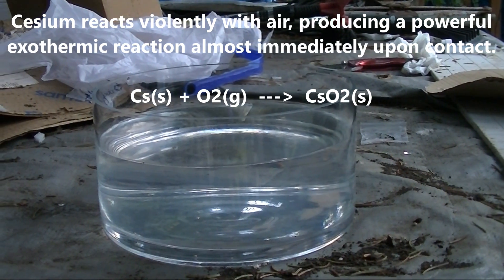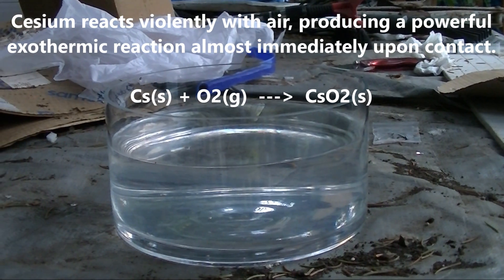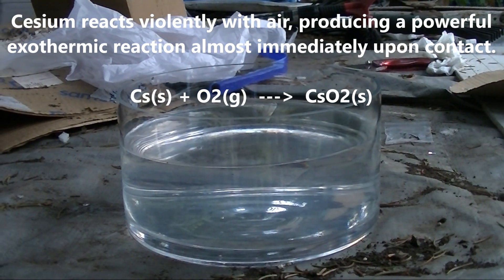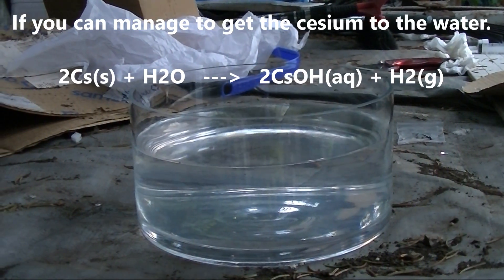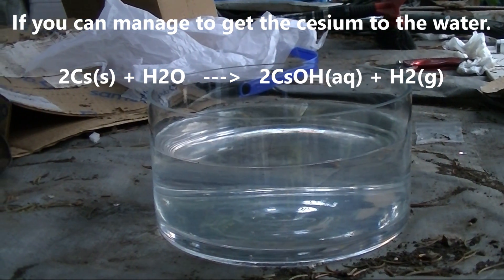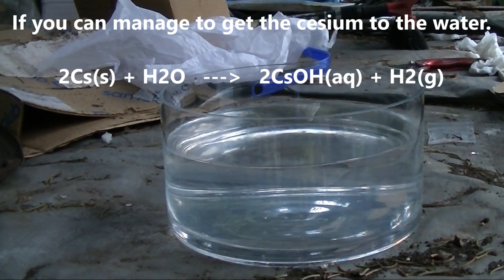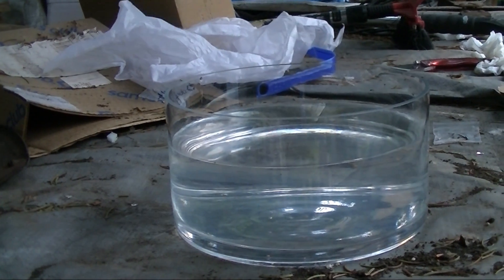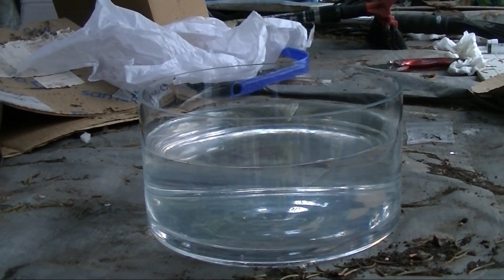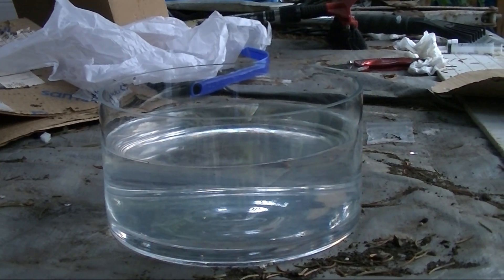I was going to attempt this with cesium as well, but the reaction with air was so vigorous that I was unable to get any of the cesium into the water before it all burned up. I had a similar problem with the rubidium, but to a much lesser extent.